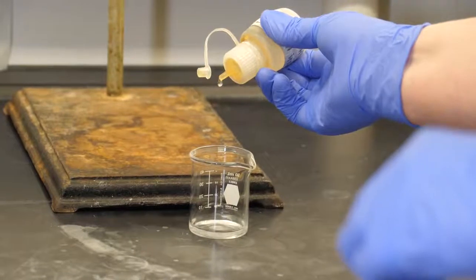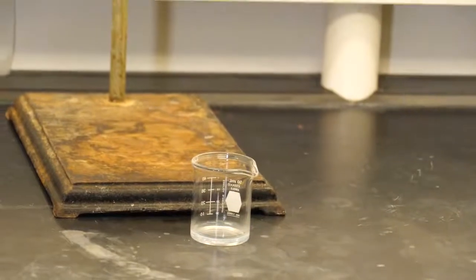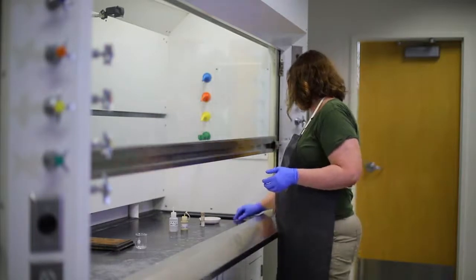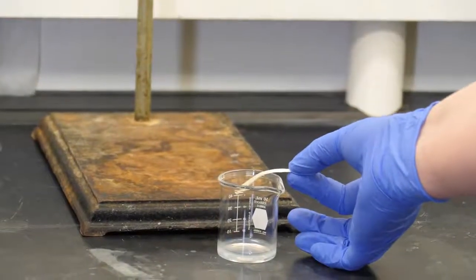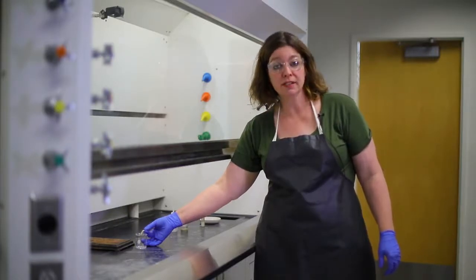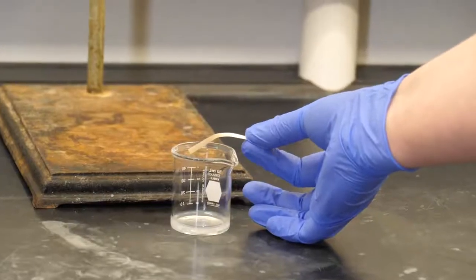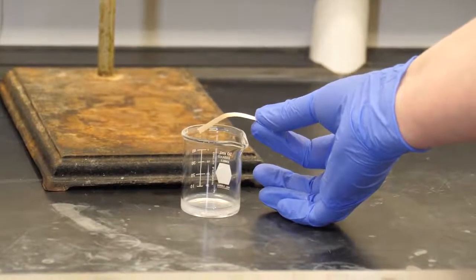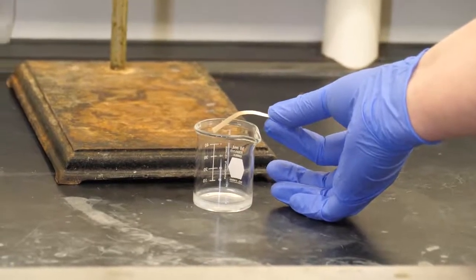When I drip in hydrochloric acid, you may not see anything. You might see this solution gets a little cloudy looking, but nothing else happens, and certainly no creepy looking vapors start to come out. But we are generating hydrogen sulfide gas, which is really toxic. It turns out that there's ways to observe toxic properties without having to directly put ourselves in harm's way. This indicator paper is called lead acetate paper, and when it comes in contact with hydrogen sulfide gas, it turns dark color. So the more gas that's present, the darker this paper begins to turn.